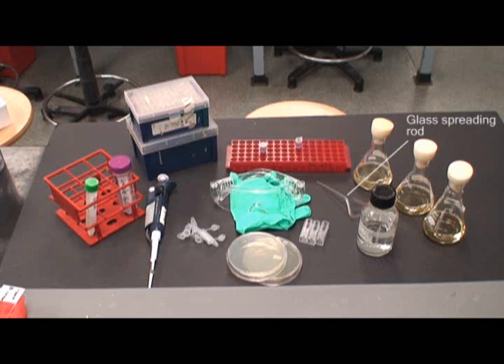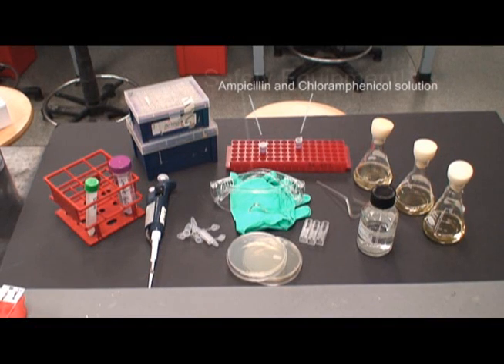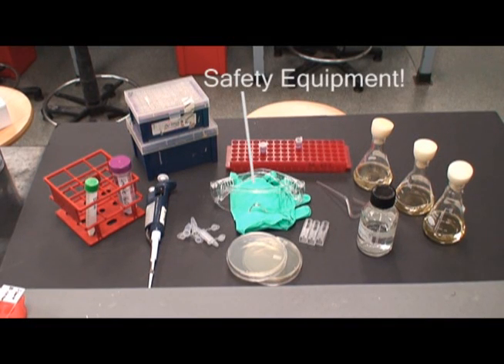Glass spreading rod, three Erlenmeyer flasks, ampicillin, ampicillin and chloramphenicol solution and, of course, safety equipment.